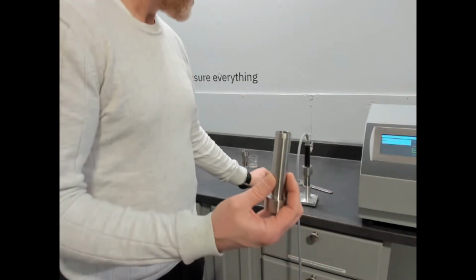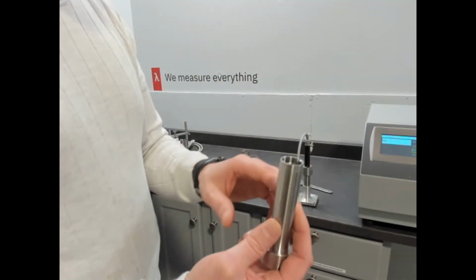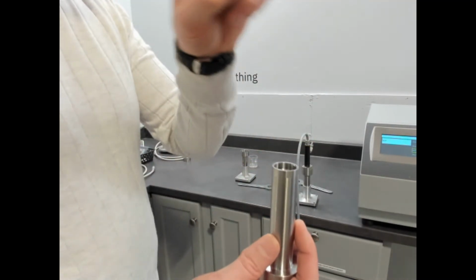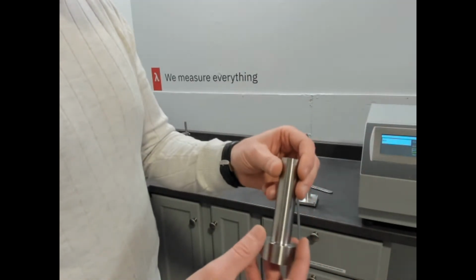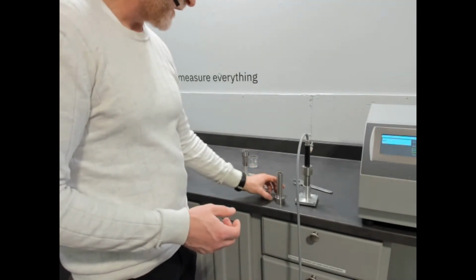So those are the different phase change cells, and with phase change you can have very good results, both increase in temperature, or when you're decreasing temperature, you can see the effects of that. I'll show you a link on the website where some of the data we have, but that's our phase change cell and powder cell components.